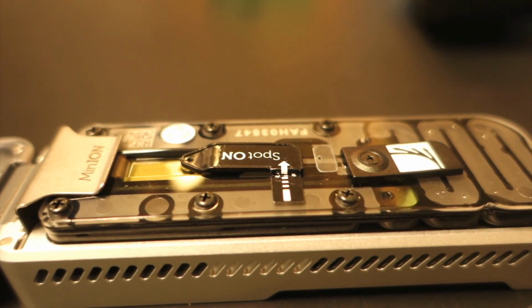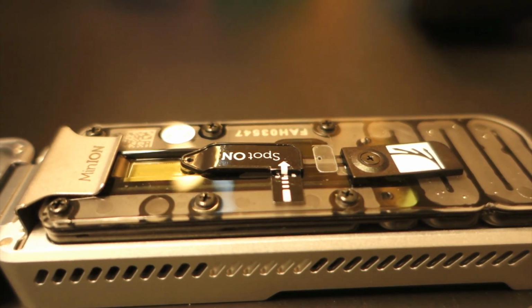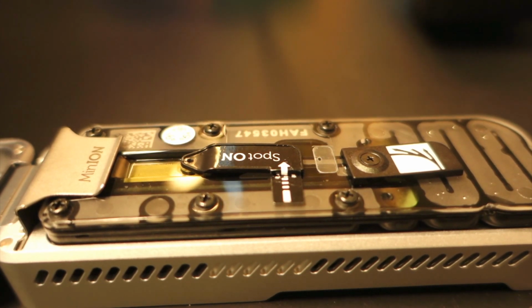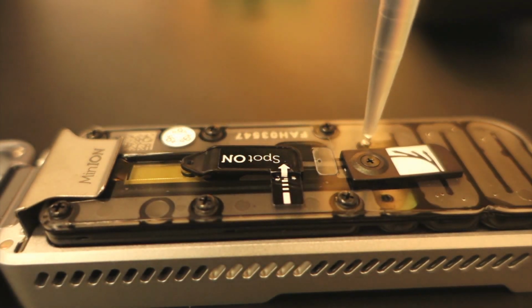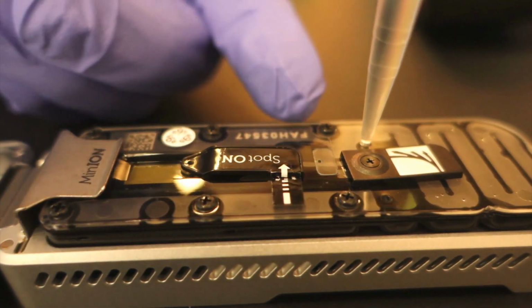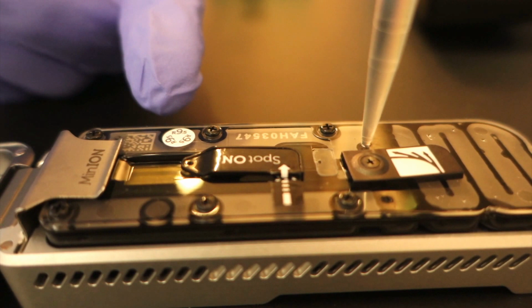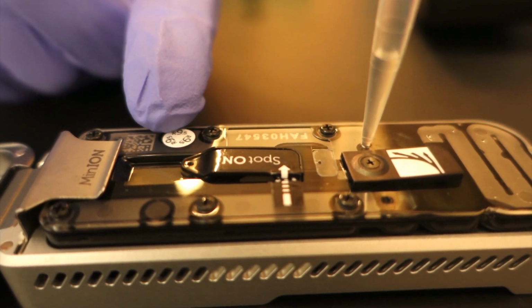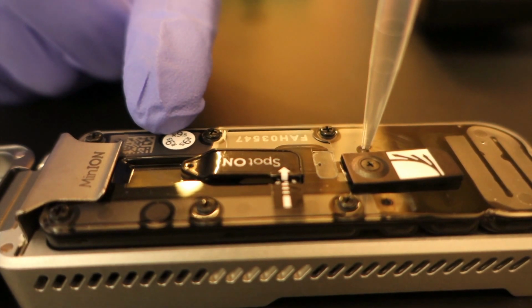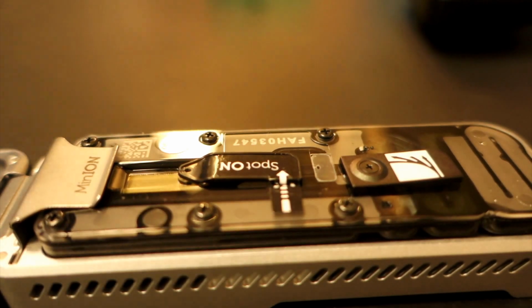So then we set our pipette to 800 microliters, and we take 800 microliters of the loading buffer and we add that to prime the cell. Now it's really important in this step to make sure we don't introduce any bubbles into the system. And as I slowly load this, you'll see the color here in the cell slowly change from yellow to clear. Now we have to wait 5 minutes.